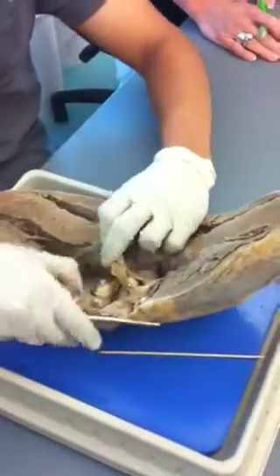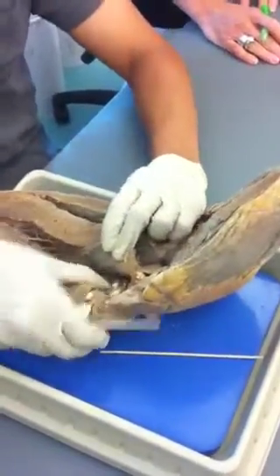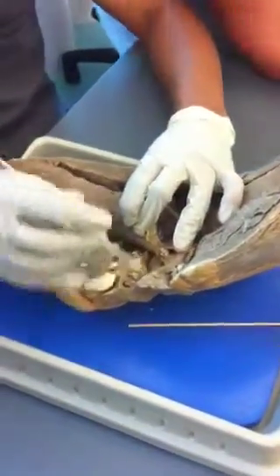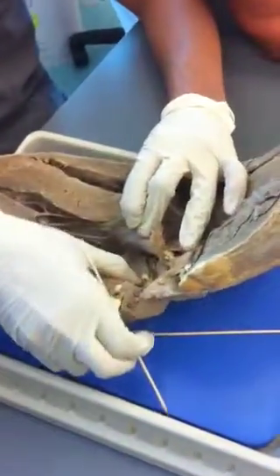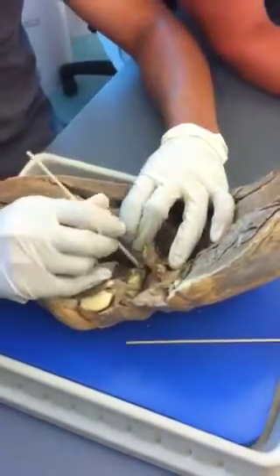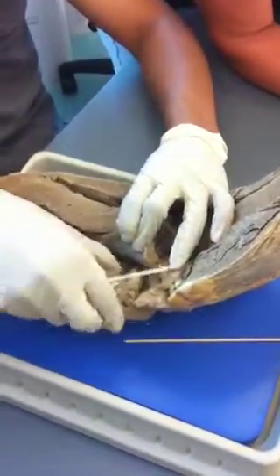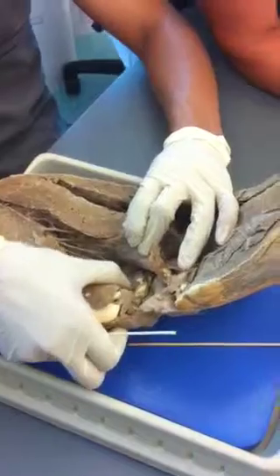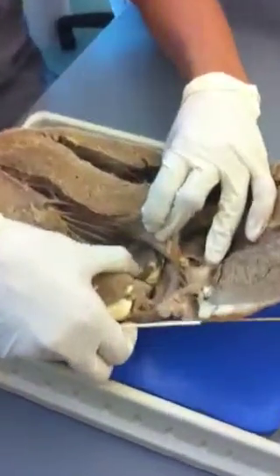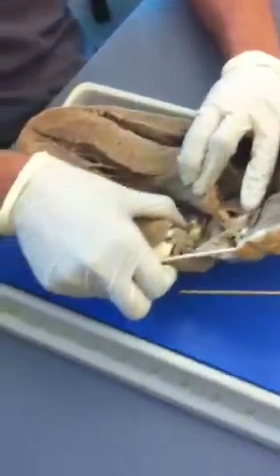So this region over here — that's the atria. So this is the chamber; that's the atria. And can you see the ridges over here when I'm running my thumb along? Yes. Those are your pectinate muscles.